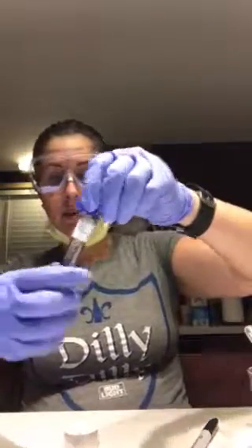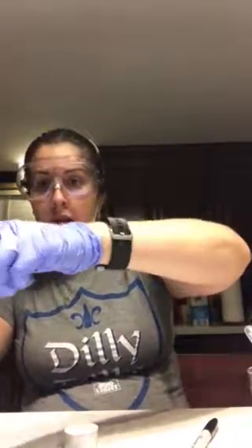I've already put my tweezers and pipette into the alcohol — they've been sitting there for a few minutes. I have my candle lit here, you can see it's already on. This is the S. epidermidis broth and we're gonna flame it to make sure there's no bacteria that's gonna be introduced into our specimen.